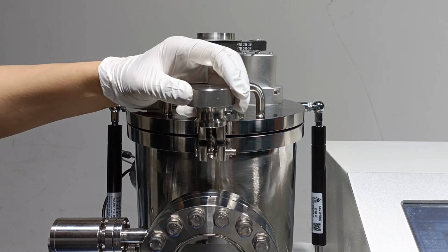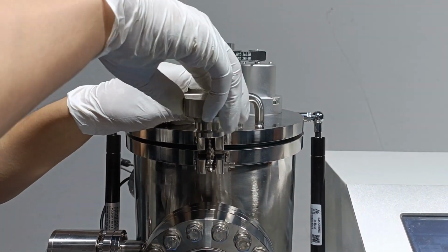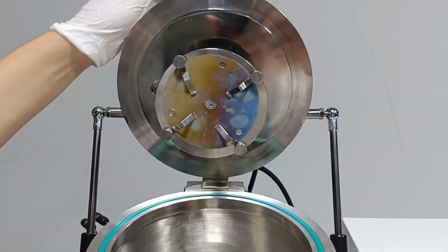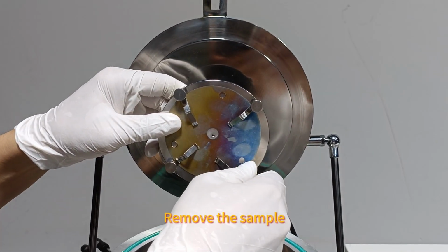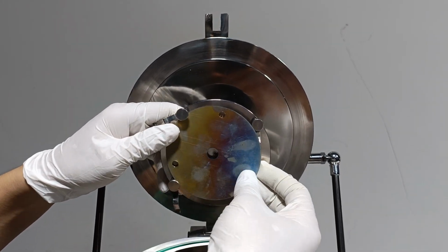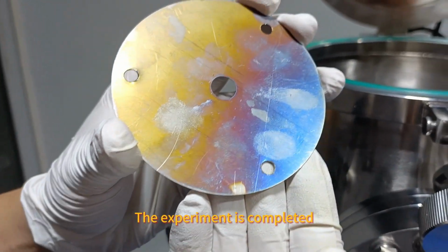Unscrew the buckle. Open the cavity. Remove the sample. The experiment is completed.